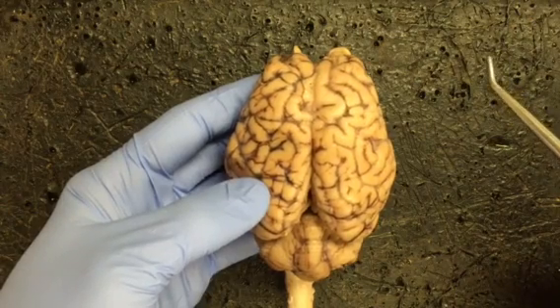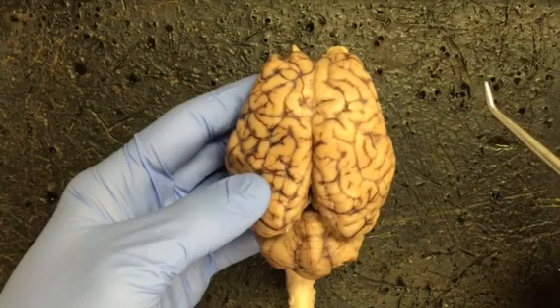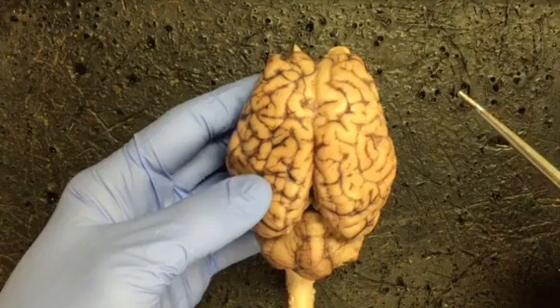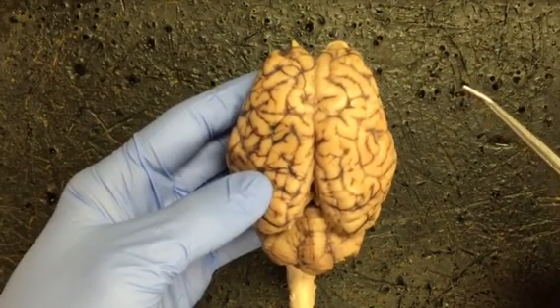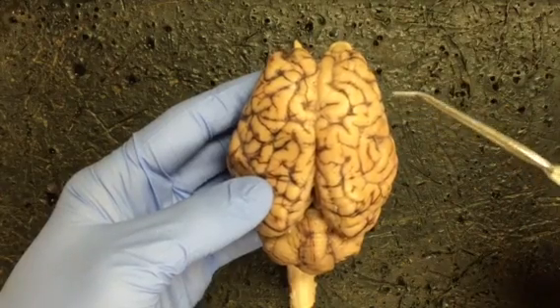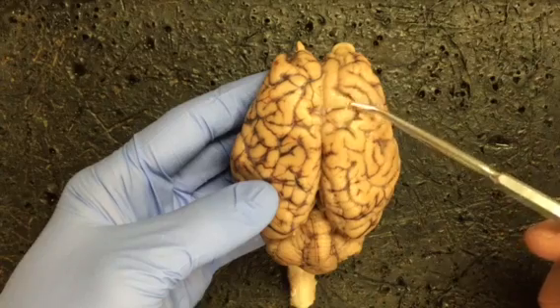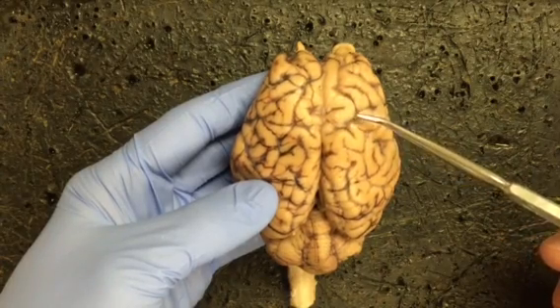The first structure, the corpus callosum, I'm actually going to wait to discuss until we look at the internal structure view. Similarly, the dura mater is something that we can't see. It's been removed as part of the preparation for our dissection. The one that we can see, though, is the pia mater. It actually is what makes the surface of the brain shiny. It's that thin membranous layer that actually hugs the surface of the brain.